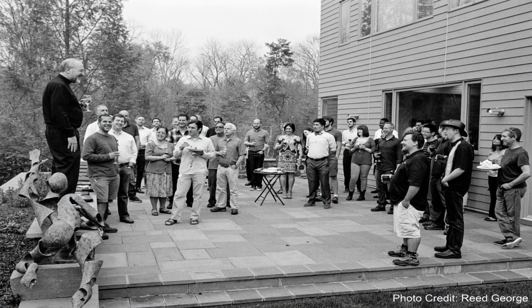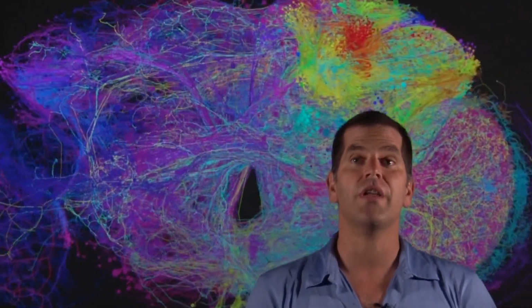To meet this scale challenge, we assembled a large collaborative team who brought skills from diverse areas spanning tissue processing and sectioning, mechanical engineering, software engineering, and large-scale image processing. Together, we developed a custom tissue processing, sectioning, image acquisition, volume assembly, and neuronal reconstruction pipeline. We improved our sample preparation methods to maximize both high membrane contrast and quality of ultrastructure preservation.